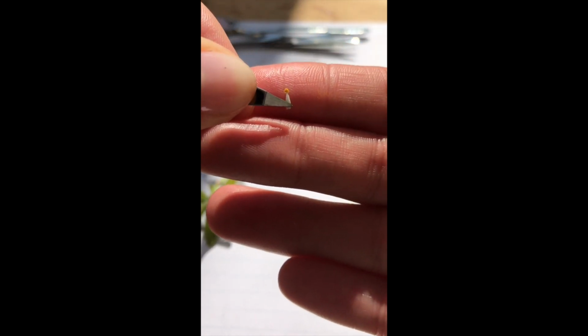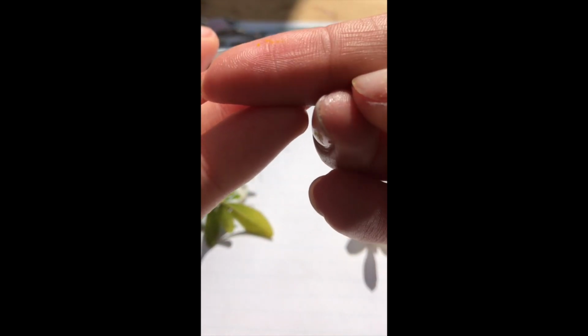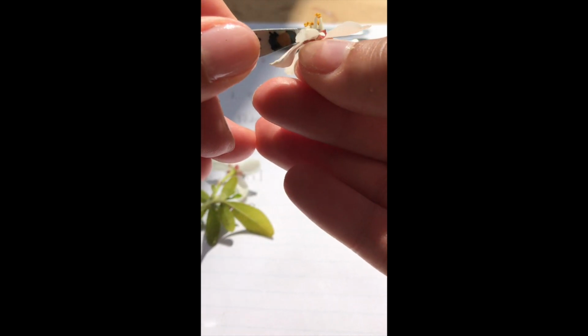So that means that that flower part's the stamen. And actually, sometimes you'll see it get pollen on you. See it right there. Okay, and then this flower, if you remove the stamens, you'll see that the pistil at the center is kind of short and chunky on this flower too.